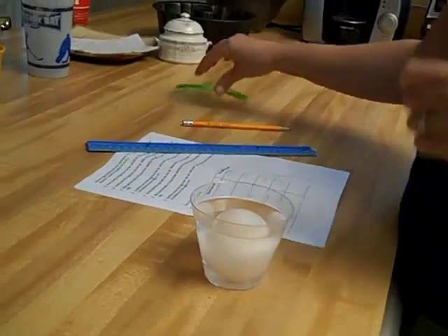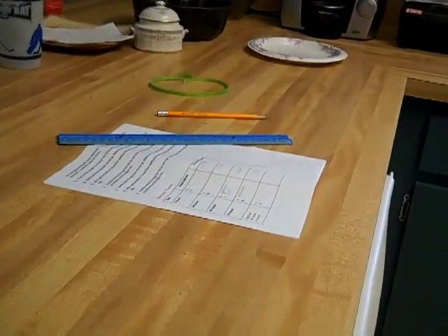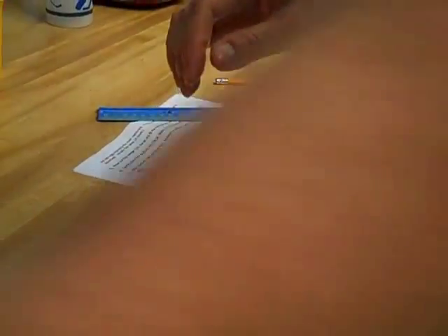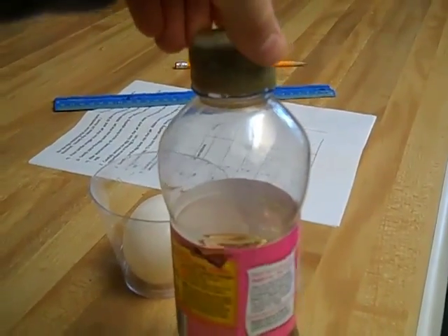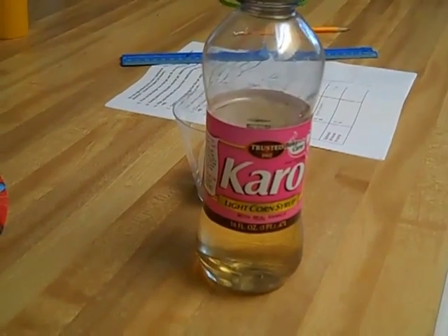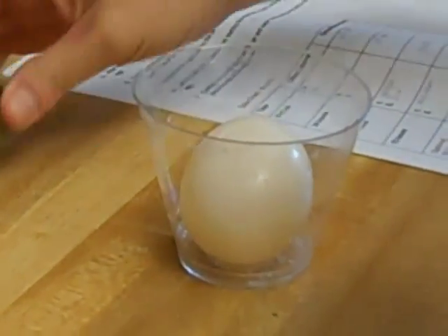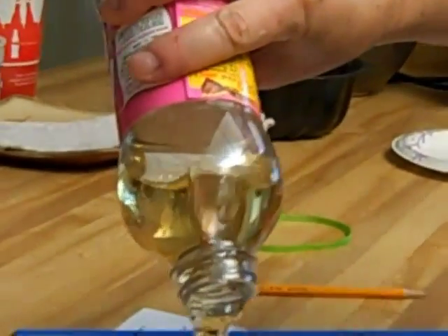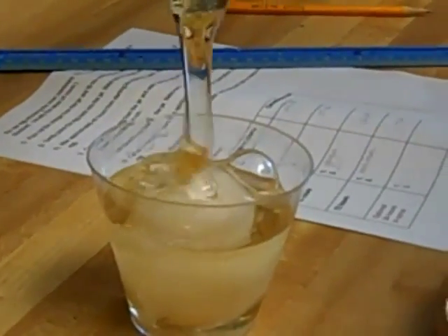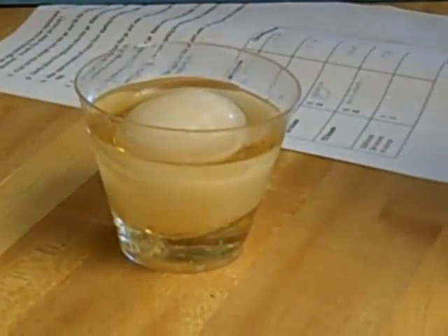We'll do the optional part — put it into Karo syrup, which is a light corn syrup now. I'm just going to dump off the water, because we're now done with the water. Always wash your hands after you work with the egg — it is a raw egg, and chances of salmonella are there. We're just going to cover this with corn syrup, which is basically a liquid sugar, and we're going to see what happens. I'll see you back in 24 hours.